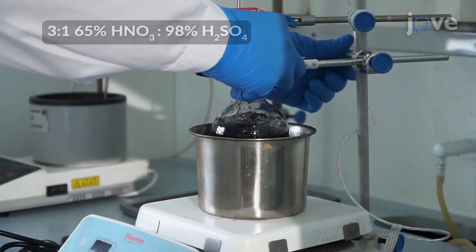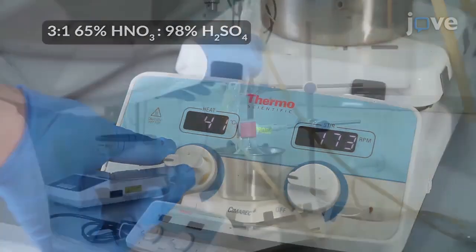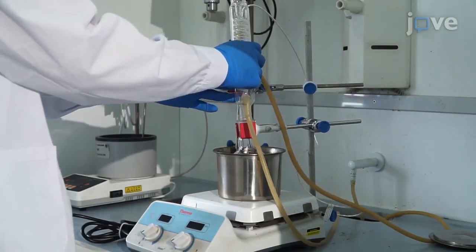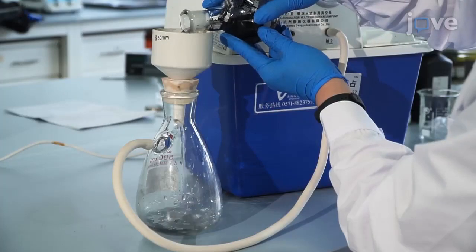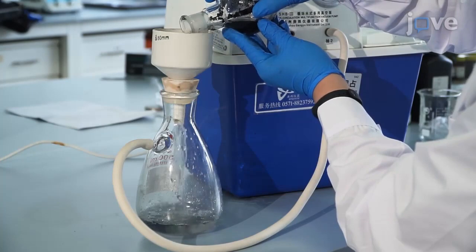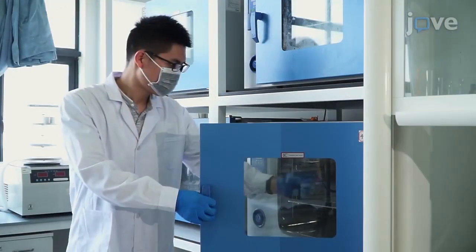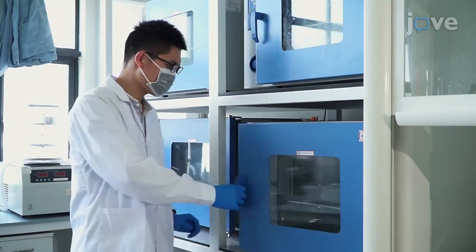Reflux the solution in a mixture of nitric acid and sulfuric acid at 60 degrees Celsius overnight to create surface defects on the CNTs. After cooling to room temperature, filter the solution to obtain the multi-wall carbon nanotube solid. Wash the solid once with deionized water. Dry the solid at 80 degrees Celsius for 14 hours.